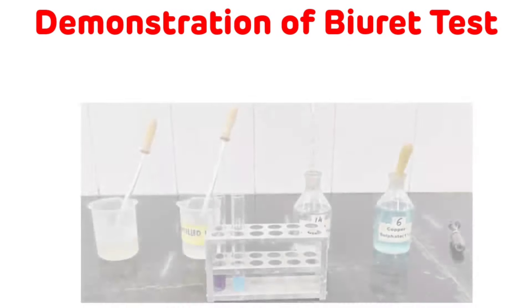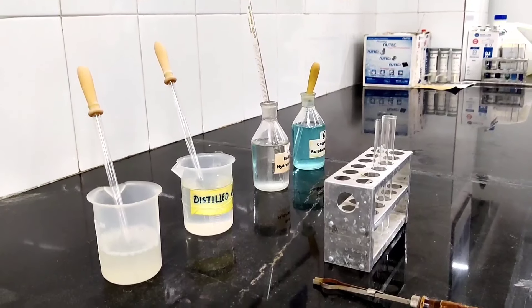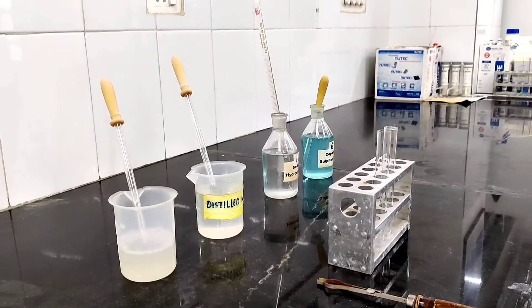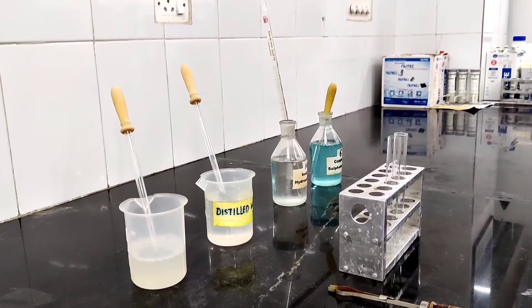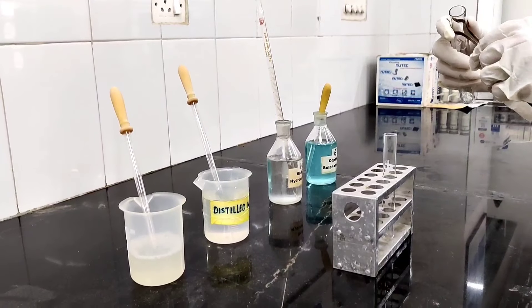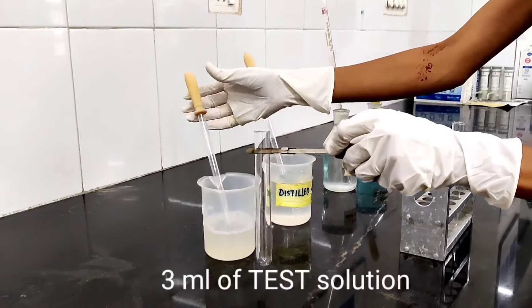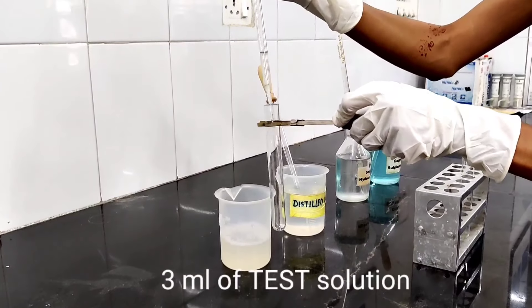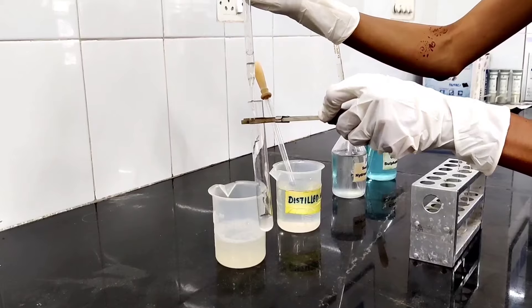Now we will see the demonstration of the Biuret test. We have already seen the theoretical aspects related to the Biuret test, which is considered as the standard test for protein. Now we will see the procedure for the same. First, in the test tube, take 3 ml of protein solution or test solution.